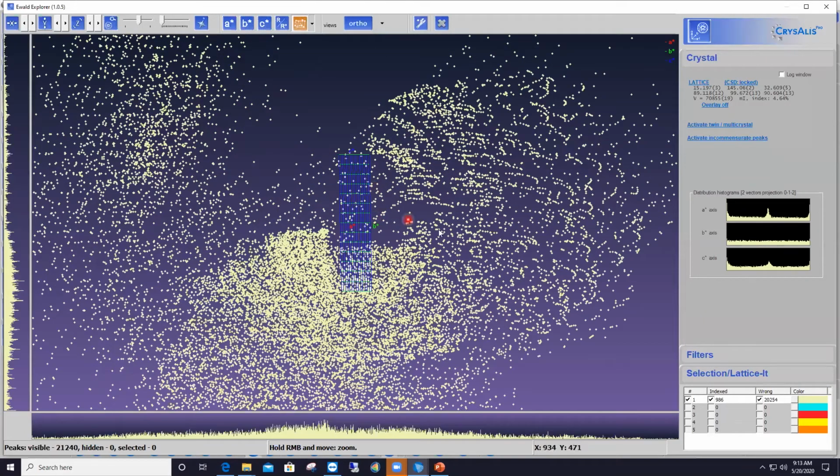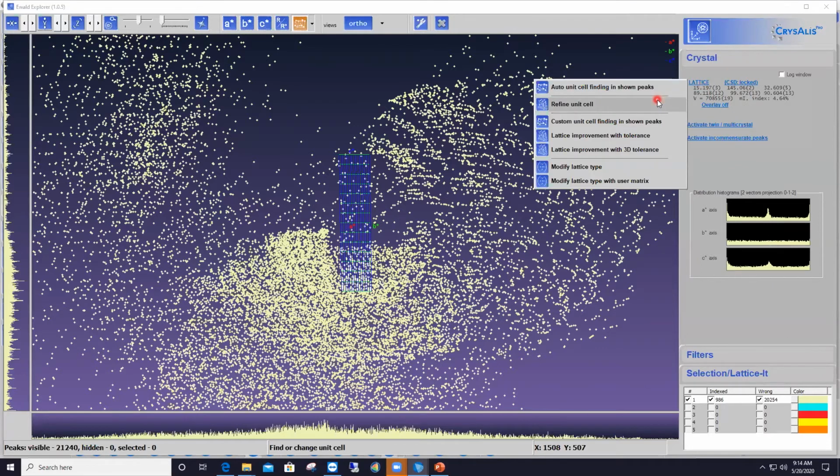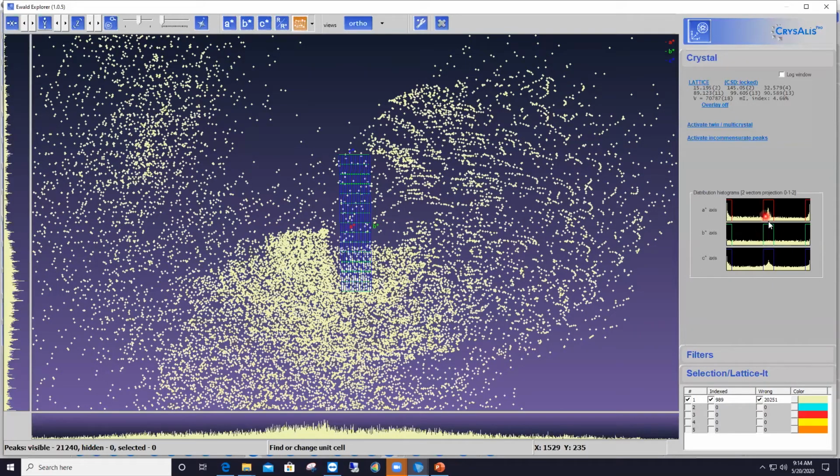So this is what the lattice looks like at the moment. The lattice that you see here. But of course, we've got very few reflections here. The program basically missed the location of the crystal reflections. You can see that on the intensity histogram on the right-hand side, along A star, B star, and C star, very weak reflections, or along B star, there's actually even nothing there. So if I make these lattice points appear, the red, green, and blue boxes, which materialize the position of the lattice points, you see that at the lattice points, there are weak or no reflections at all. So that's because our unit cell is wrong.